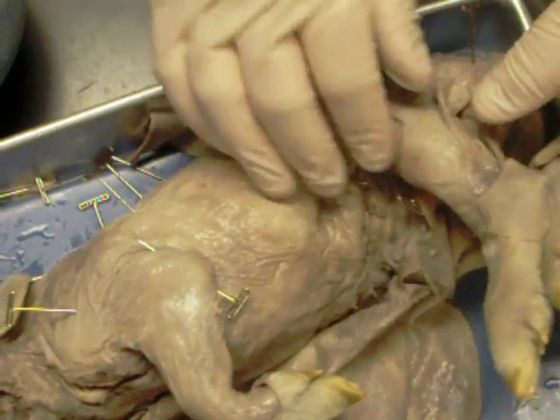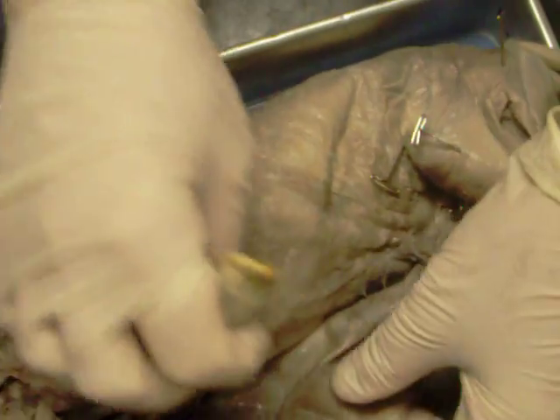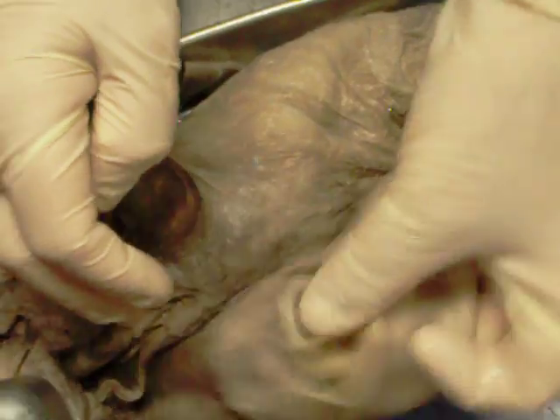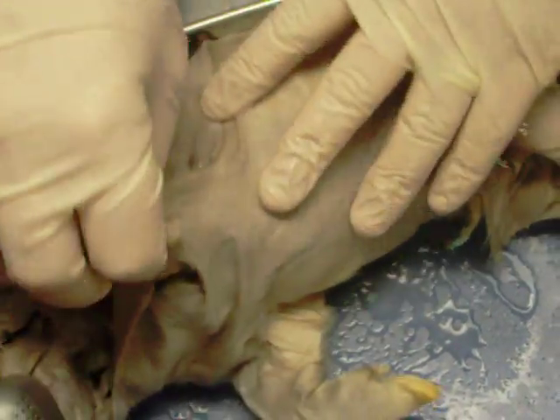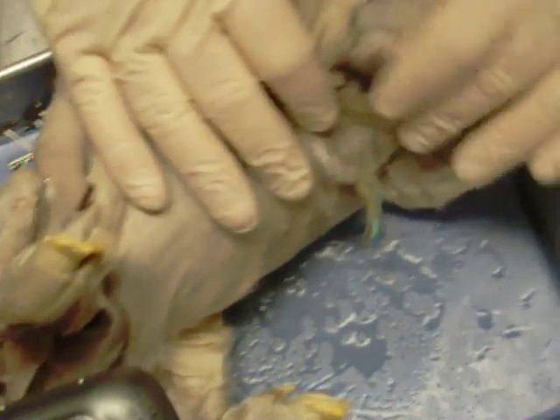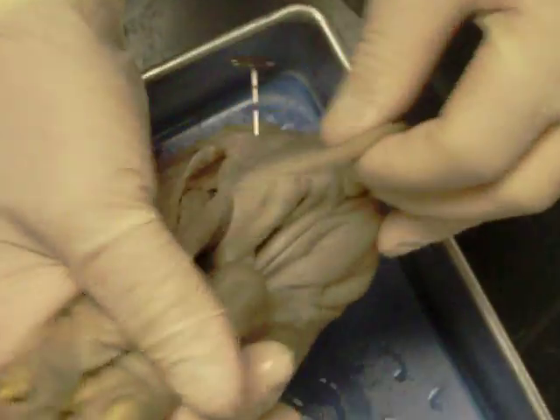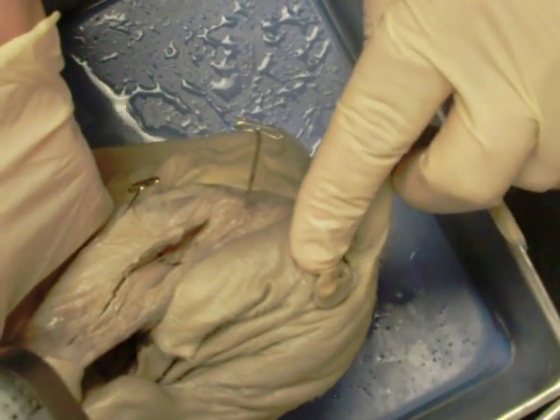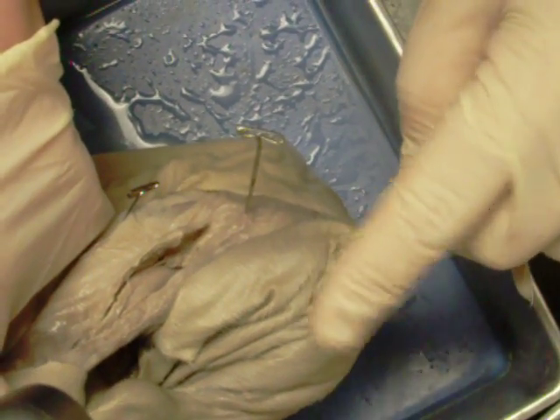Continuing external anatomy. We have the mammae, and this is a female. Looking around the back side, we have the anus, the urogenital opening, and the urogenital papilla.